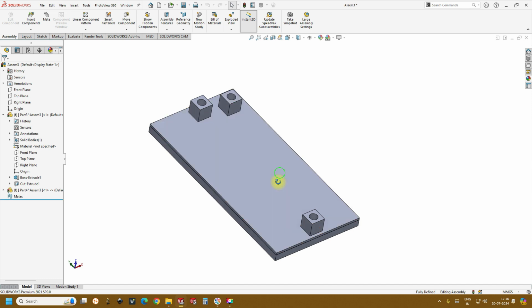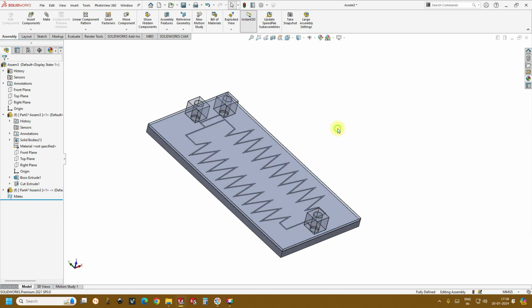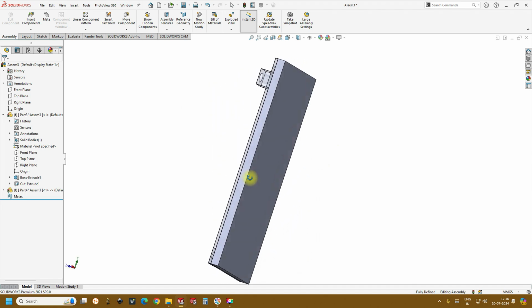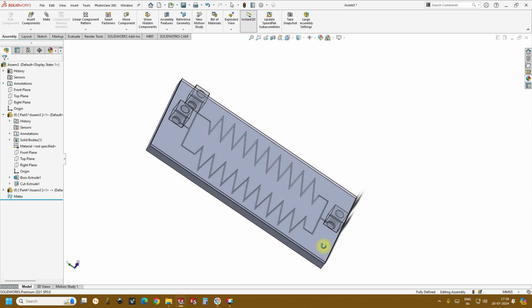So if you want to see the internal micro channels, just click on the surface, make it transparent. So this is how the final microfluidic device looks like. So it splits and mixes and then gives you output.